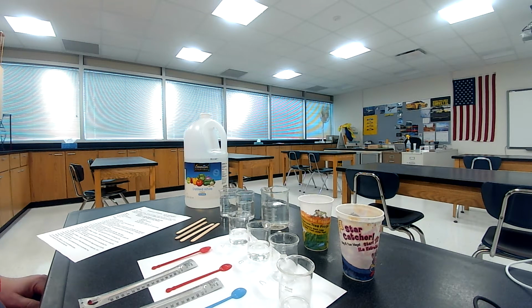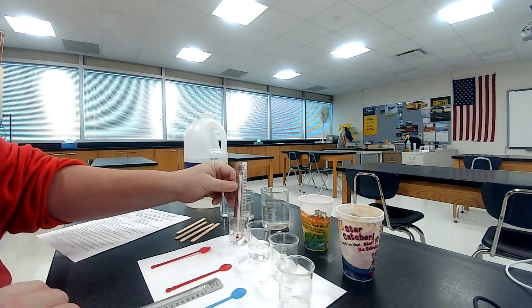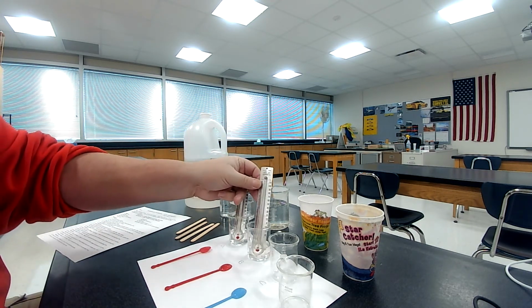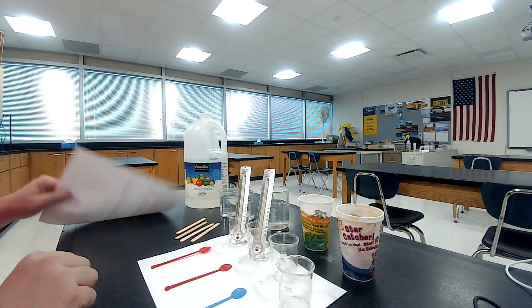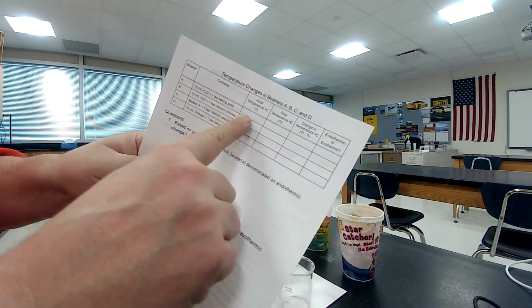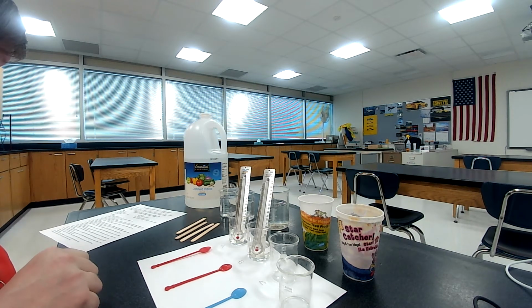Measure the water temperature in A and B and record it in the data table. Okay, so what I'm doing is I'm going to take my thermometer and I'm going to put it in here. I want to make sure that bulb gets under there. And I'm going to do the same thing with this. I'm going to let that sit there and get to temperature. We'll see what it says here. And it says we have to record that in the data table under the initial temperature of A and B. And you're going to see that that's located up in here. Initial temperature A, initial temperature of B. Okay, so we're just going to leave that here for 1 second.